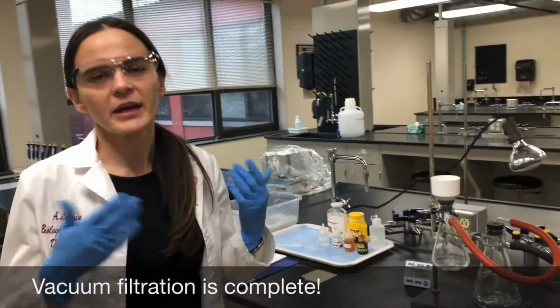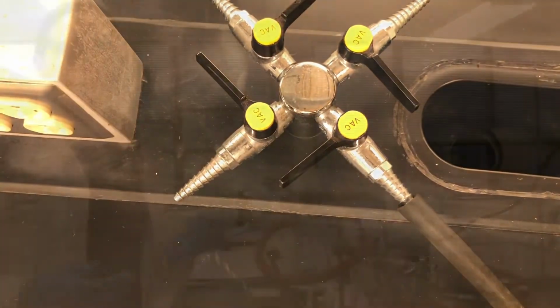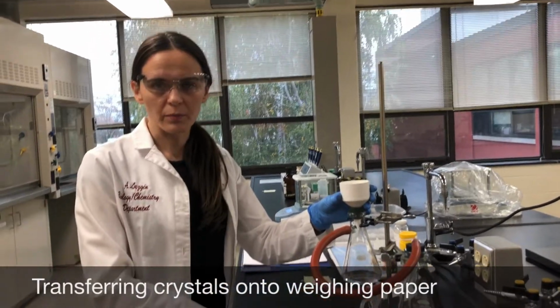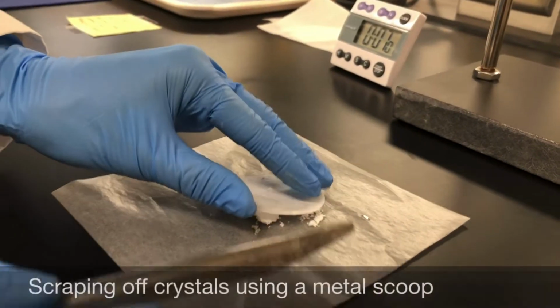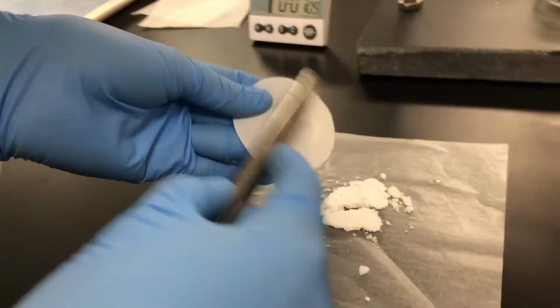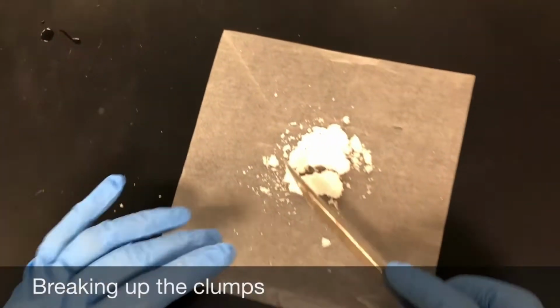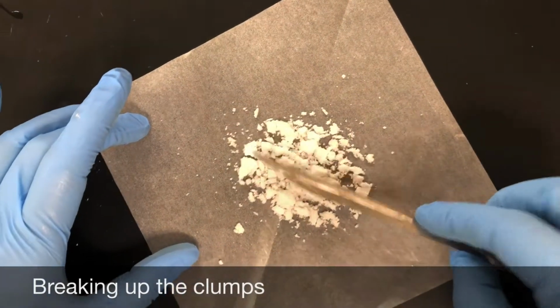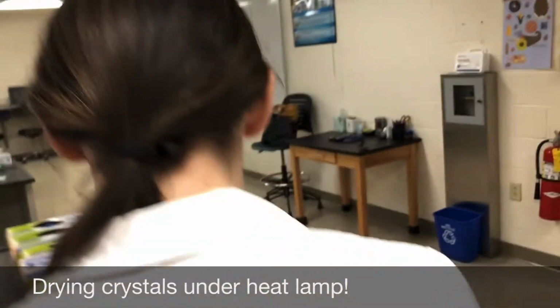Okay, so now that the vacuum filtration is complete, I'm going to shut the vacuum line off all the way. The next step, I'm going to remove the crystals onto my large pre-weighed weighing paper. Now I'm using a metal scoop to scrape off the crystals. Next, I'm going to break up the clumps so that the crystals dry quicker. Then I'm going to put them under the heat lamp until they're dry.